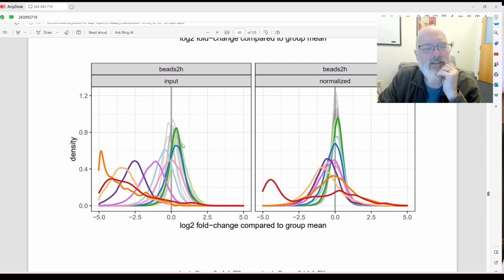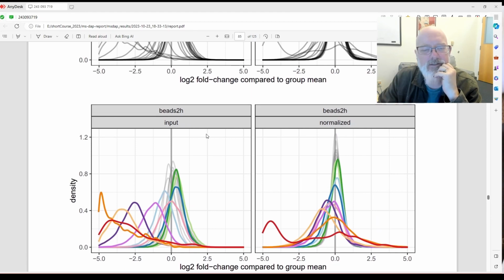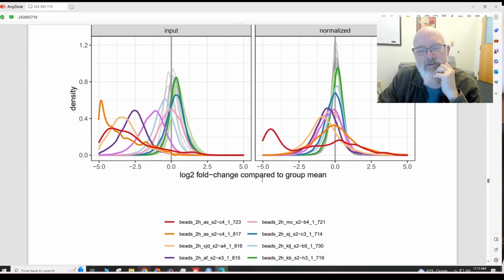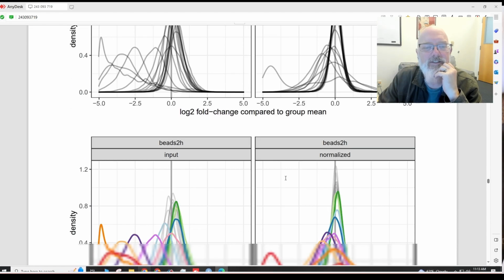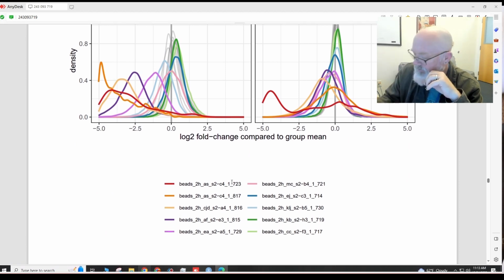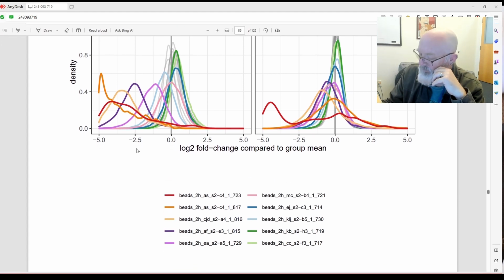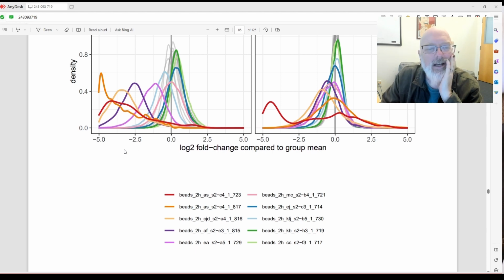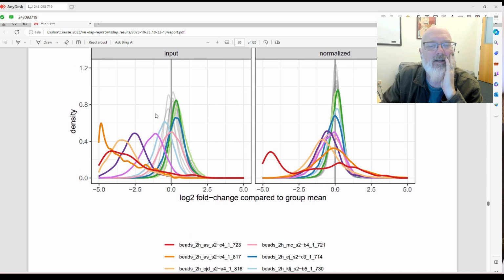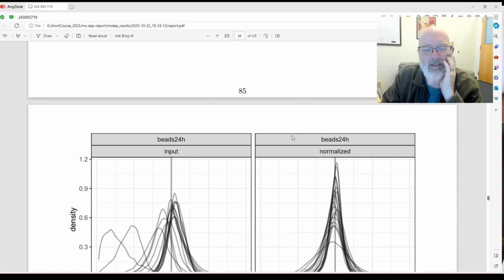And then let's see, what's the difference here between this one? Input. Okay. Log 2 fold change compared to group mean. Log 2 fold change. Maybe this is just colored. Oh, and it tells you the different samples. So you can, for example, 723 was one we were going to exclude, and that's this one. And 817 we were going to exclude. And 814, that might have been a different one. But you can maybe use this as a cutoff on what samples to exclude. Like maybe you'd definitely exclude 723 from the next analyses.